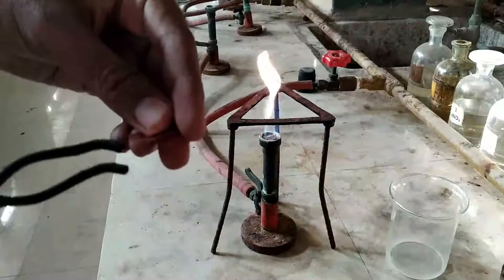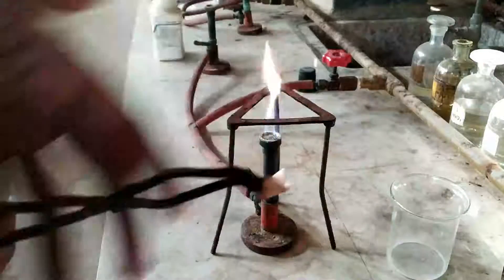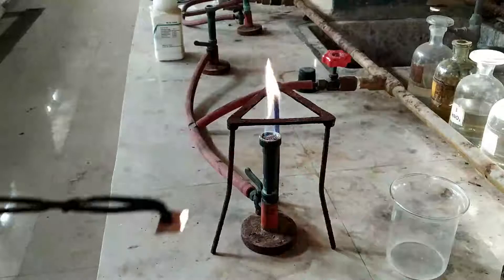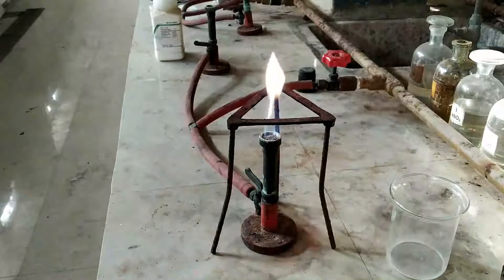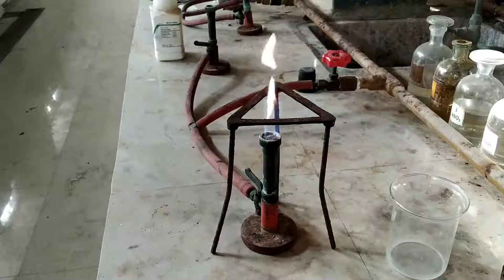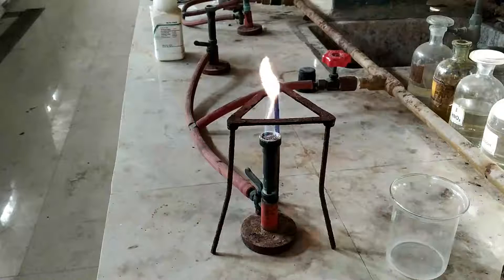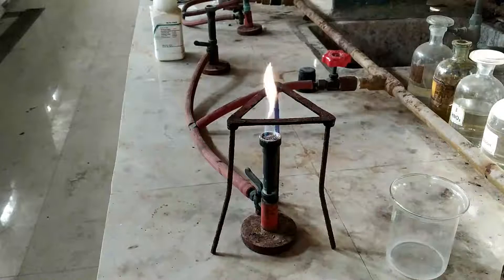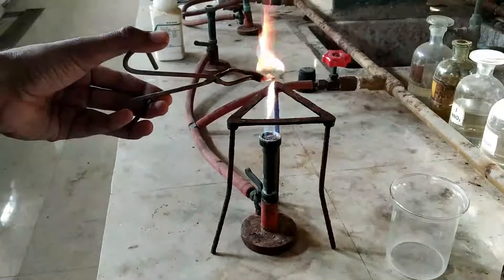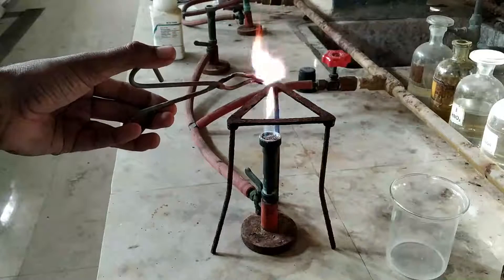For this, the copper foil must be pure, and while adding the substance you should be very cautious about keeping it away from the flame. This substance is liquid, so I have poured that substance and am now heating it on the flame.